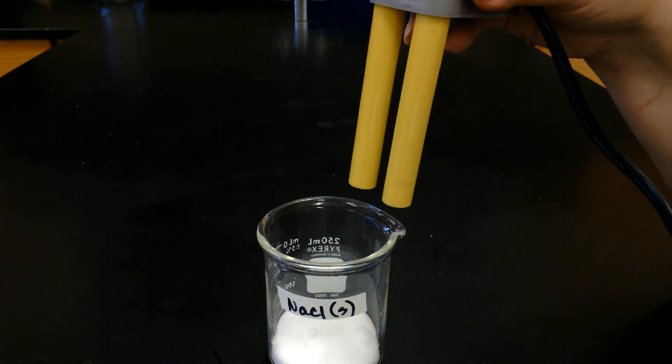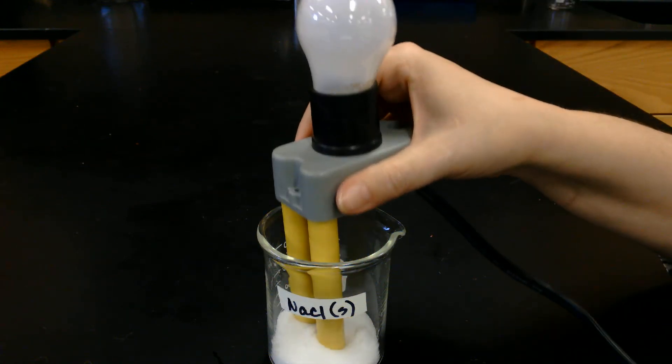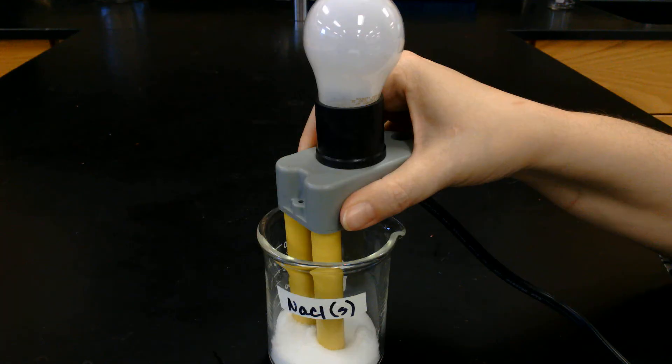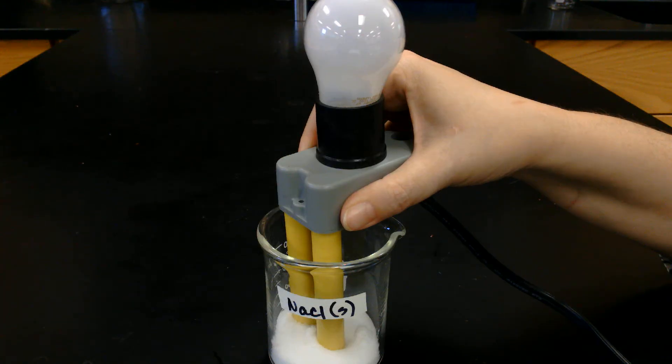Next, we're going to test some solid sodium chloride — a little table salt. Go ahead and make your observations.